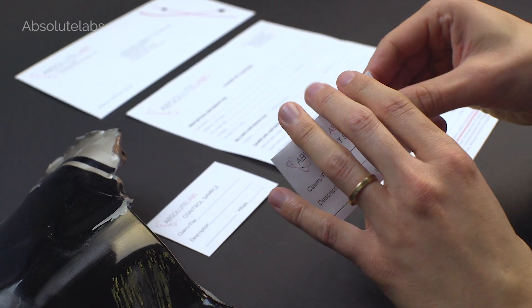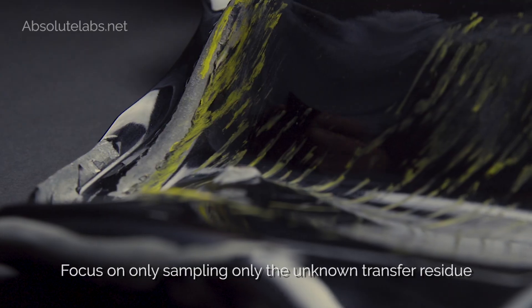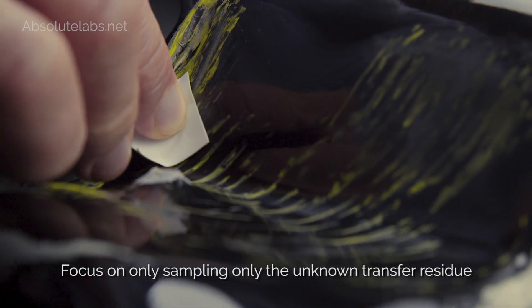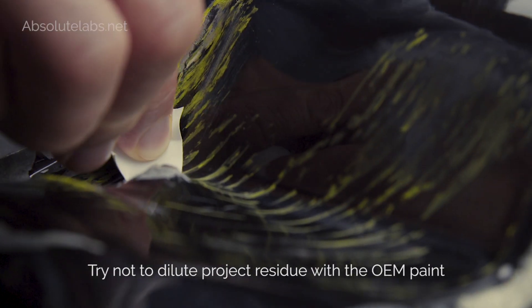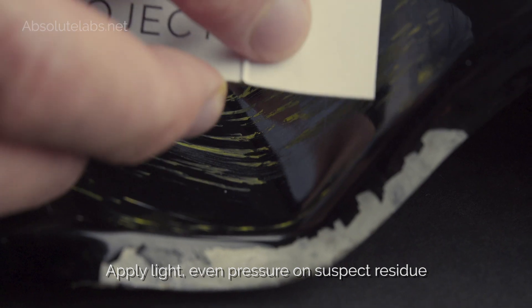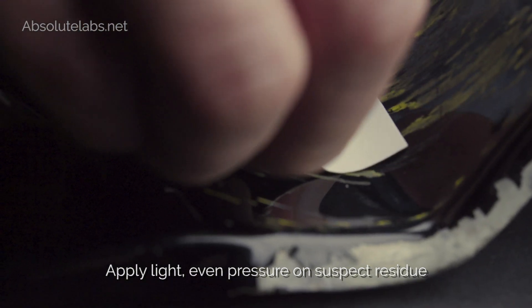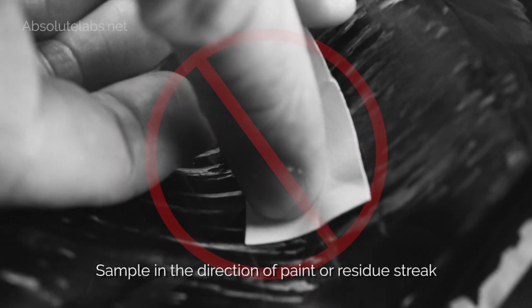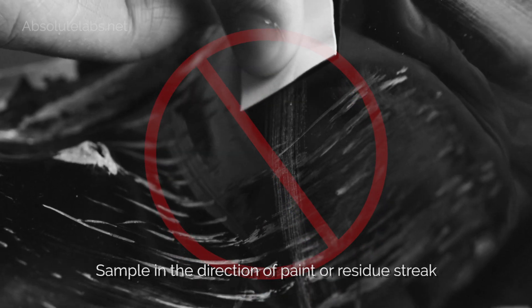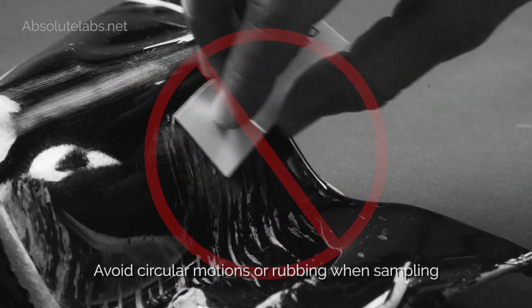Tips for obtaining a high-quality project sample: Focus on sampling only the unknown transfer residue. Try not to dilute project residue with the OEM paint. Apply light, even pressure on suspect residue. Sample in the direction of paint or residue streak. Avoid circular motions or rubbing when sampling.